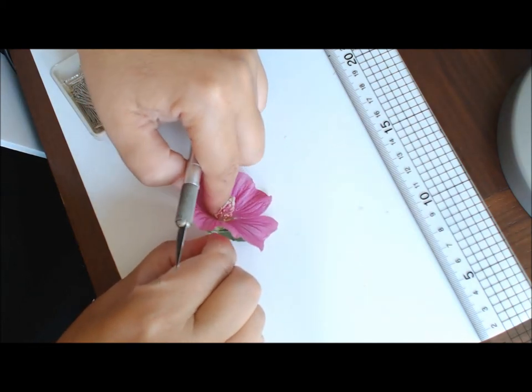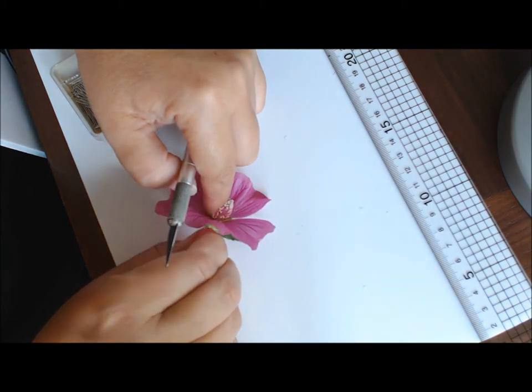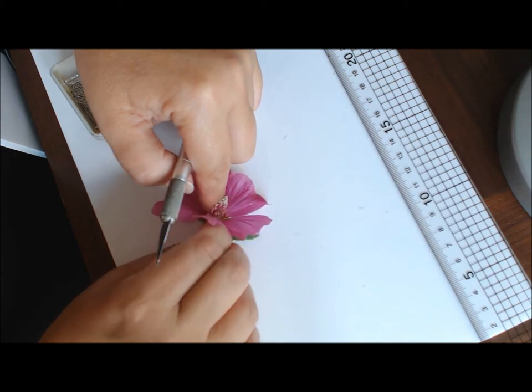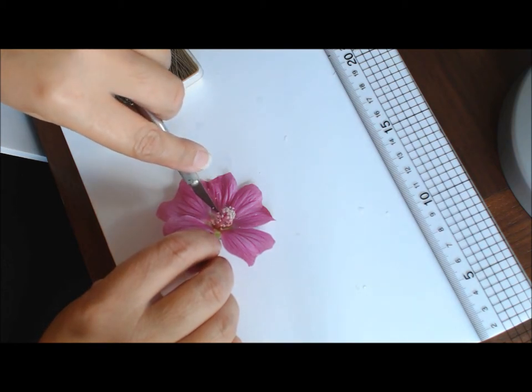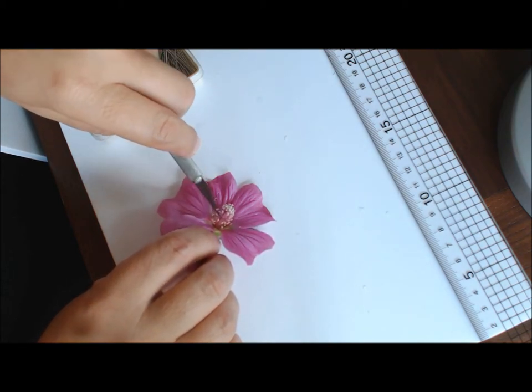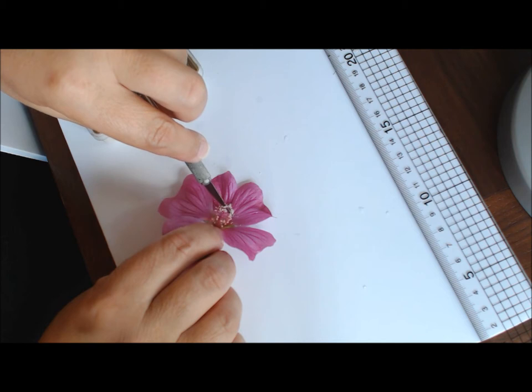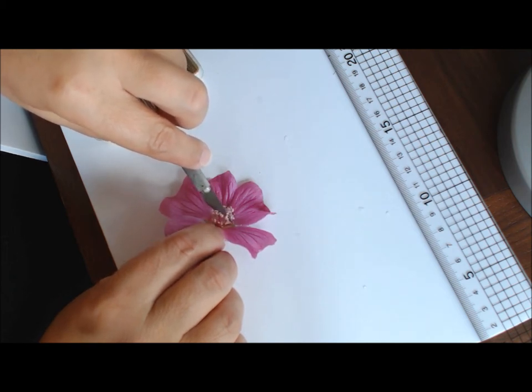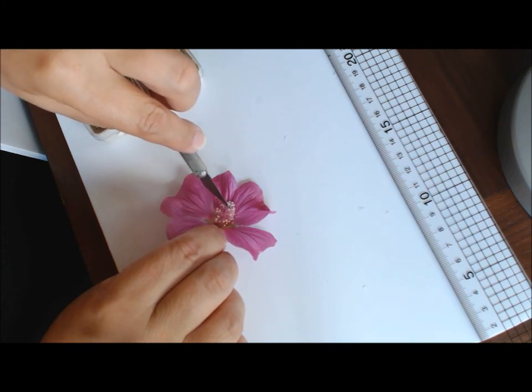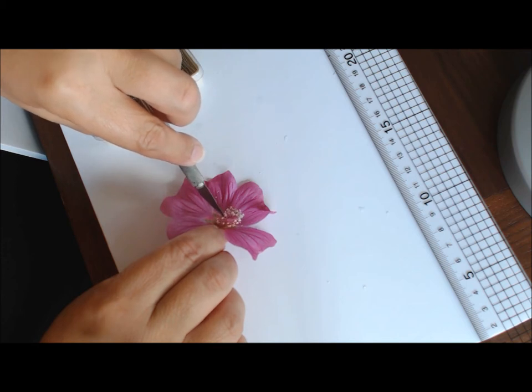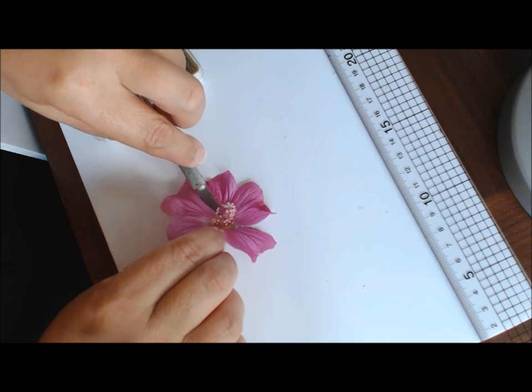I tend to go straight through there, and then end to go straight down the center. You can't get into it immediately, but you can do it in parts. I'll just cut away at it slightly on this one because it's got this column in it, so I want to expose the center of the column, but I don't want to go straight through it so far as to remove parts that I don't want to remove.